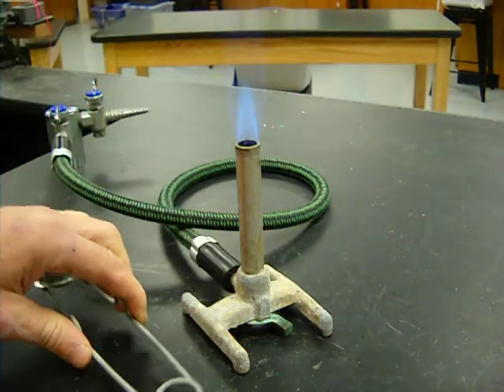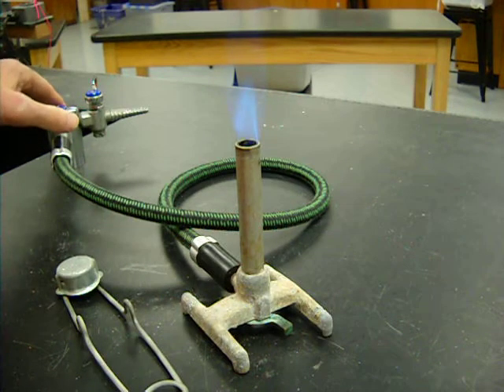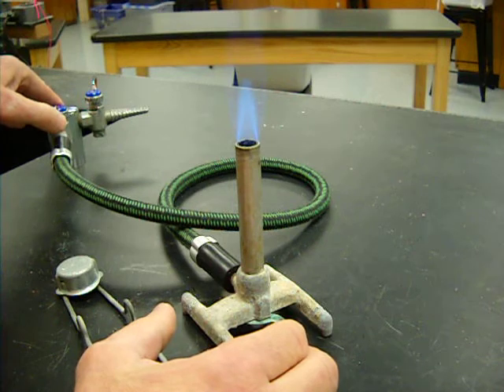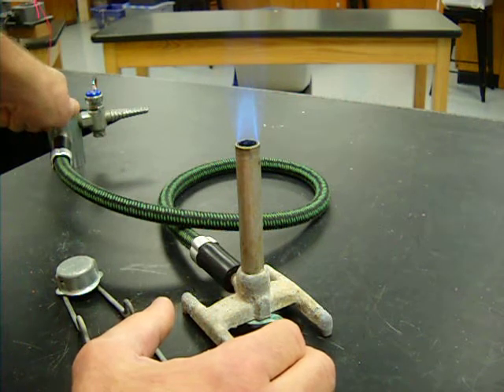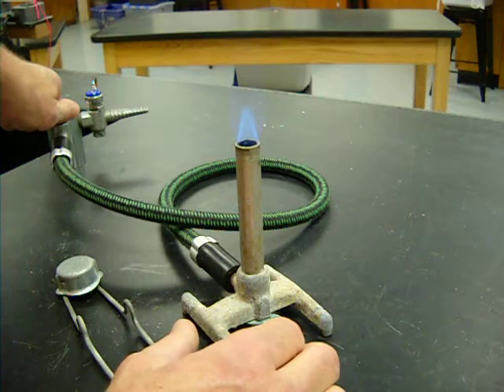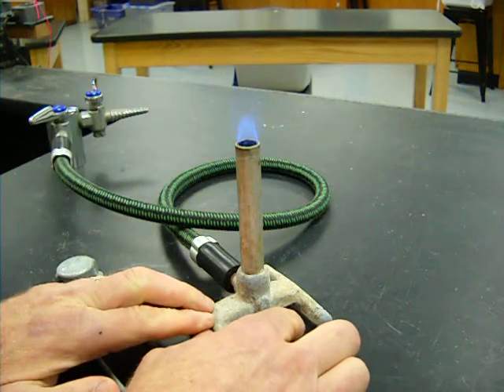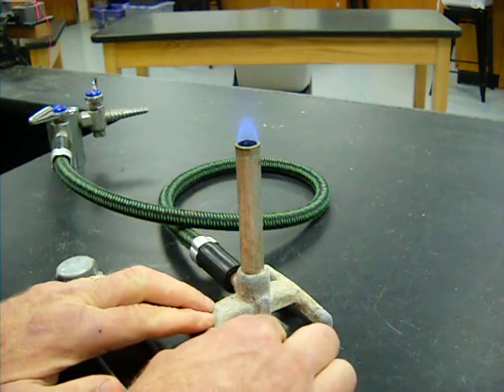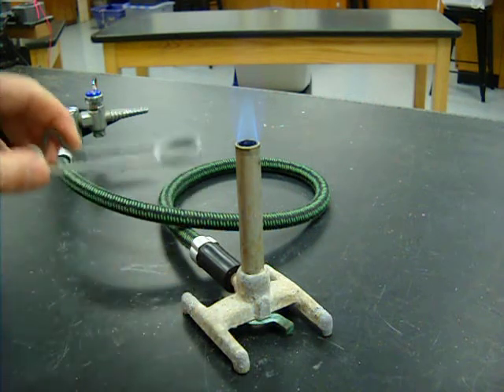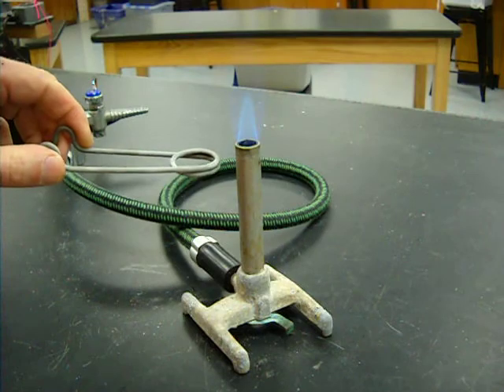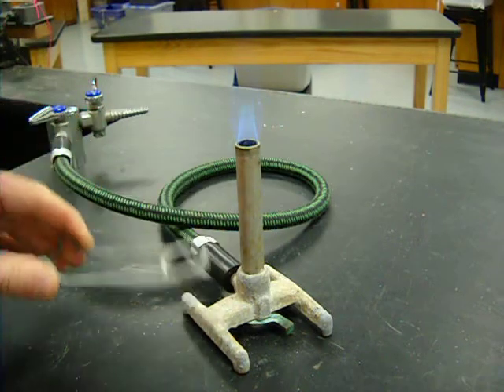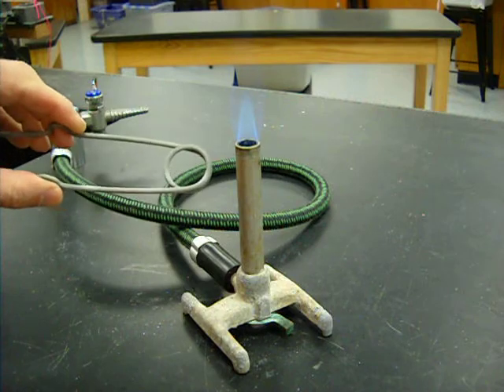But this is a little bit too turbulent. You can hear it. It almost seems a little bit unstable. I'm going to back off from the gas supply a little bit. Get it to calm down. Maybe try to add a little more air to it. No, I like the flame back where it was. Right about there. I have a nice cone of flame. I have just a little bit of turbulence. This is the kind of flame that we're going to want to use in our lab.